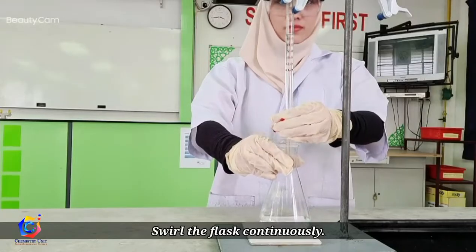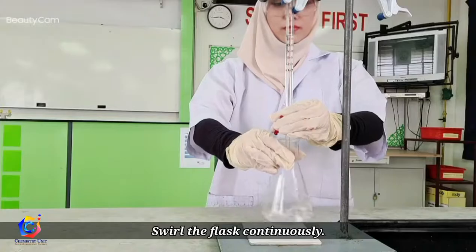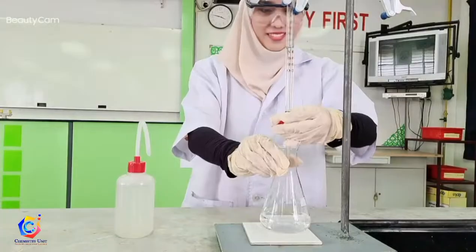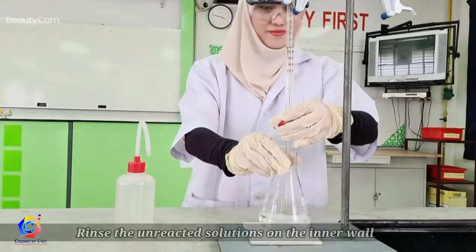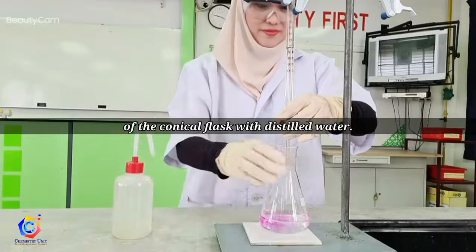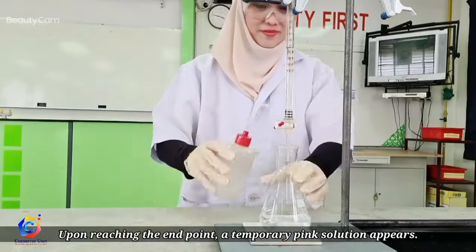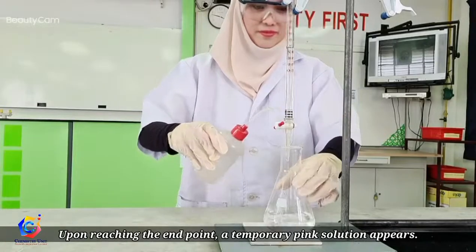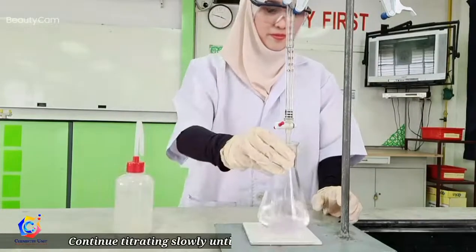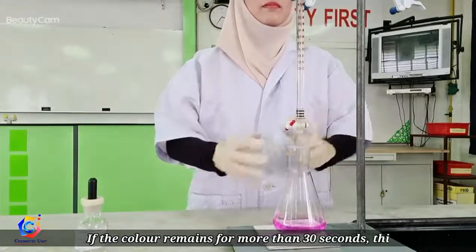The first titration is always a gross titration, in which we can estimate the gross volume of titrant needed in the process. From time to time, rinse the unreacted solution on the inner wall of the conical flask. Upon reaching the end point, a temporary pink solution will appear, but it fades when the solution is swirled.